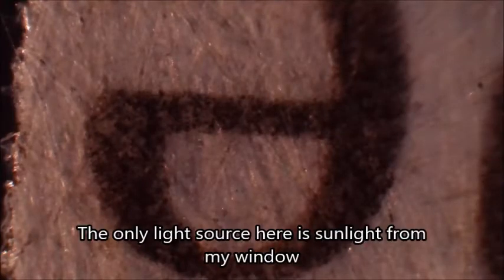Okay, now whilst we're looking at it, I'll turn the light down so you can see what difference that makes on the view. Well, see, that's actually with the light turned off completely. So now we're looking at it from the top down. We're not actually looking through it anymore, which is pretty cool. You can really see all the particles in the paper. Turn the light back up and you can see straight through it.